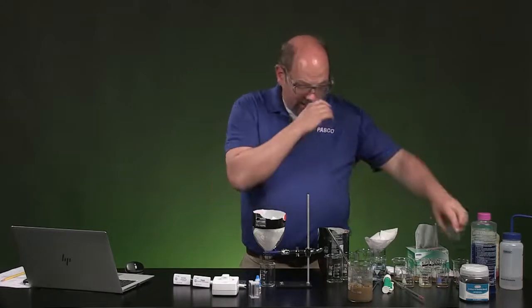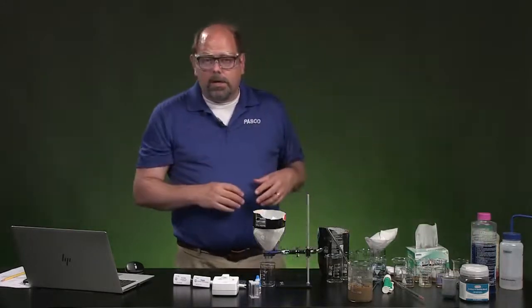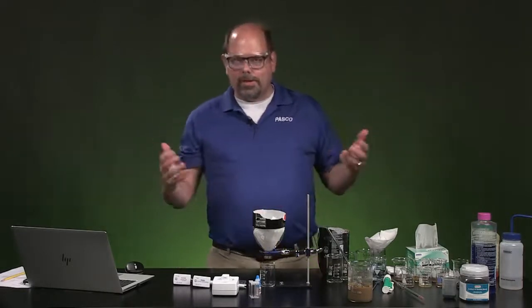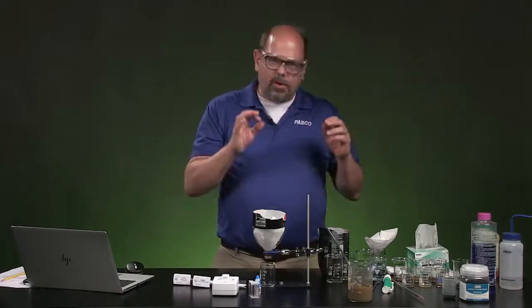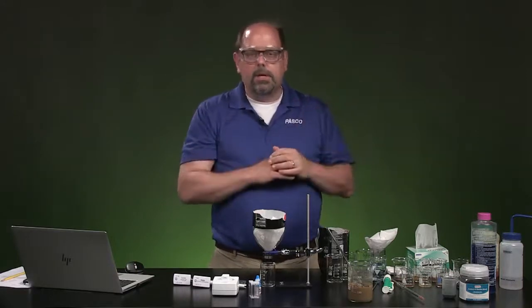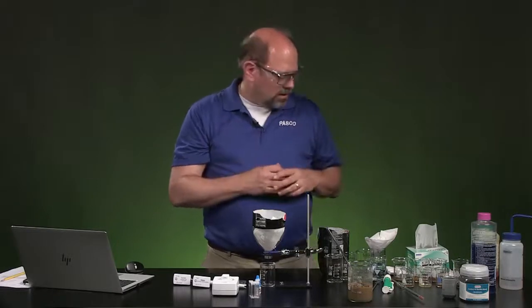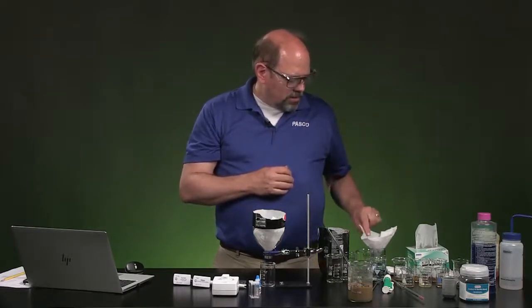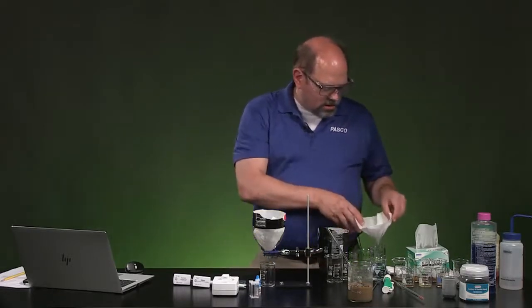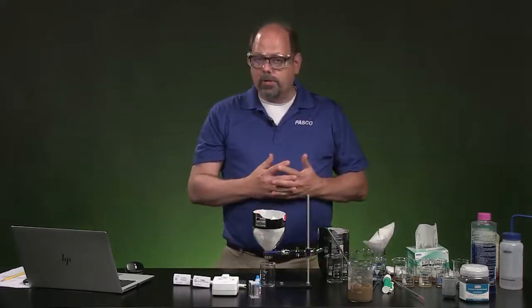That carbon in there is going to be good at taking out things that have some smell to them that may be dissolved. It has an attraction to molecules in the water, things that aren't just particles like sand or even silt, but that give the color to water, give the smell and the taste to water. So this is going to be one of the methods, to pour through this particular filter, and I'll show you that process when we start gathering data.